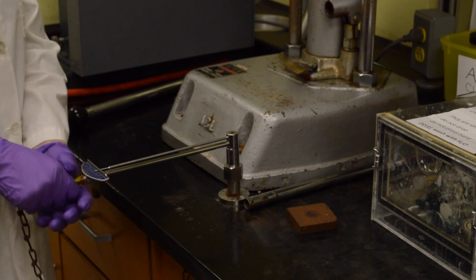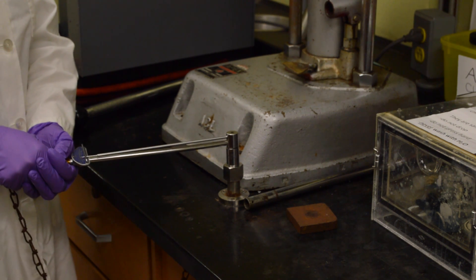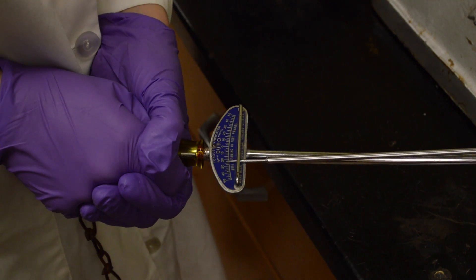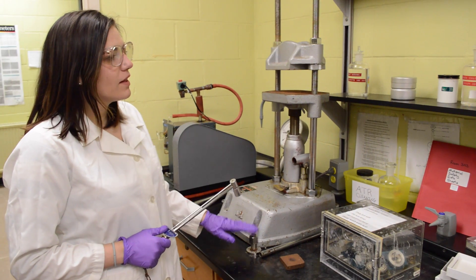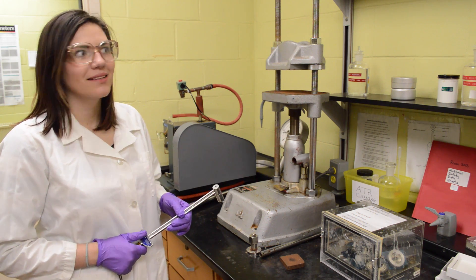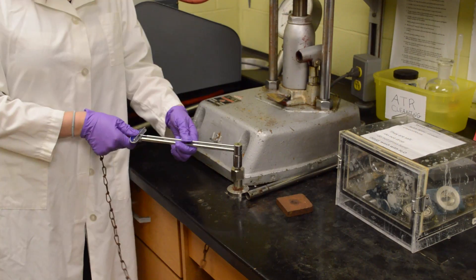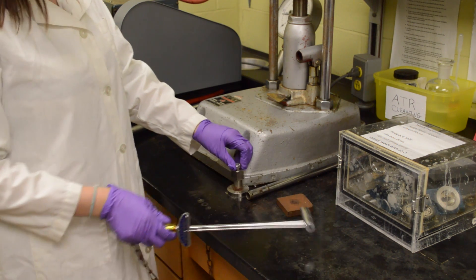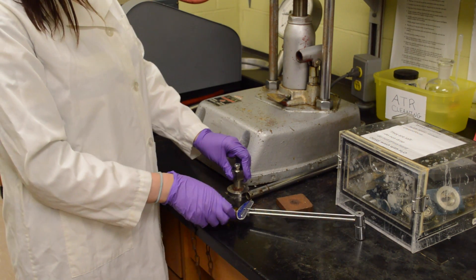So close. You want to allow that to set for one minute. Magical one minute. If you remove the bolt, you do the opposite of what you just did. Then you should just be able to remove it with your fingers pretty easily.